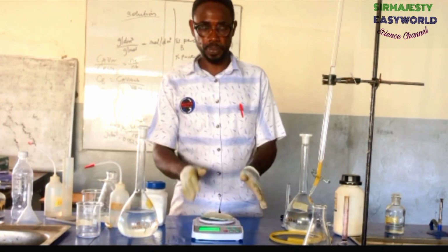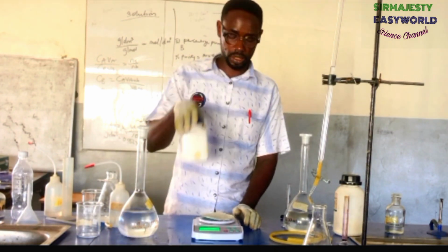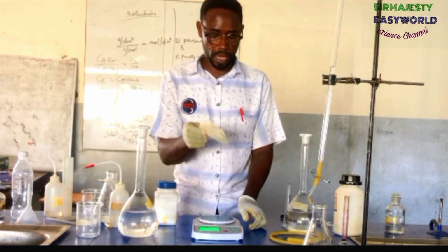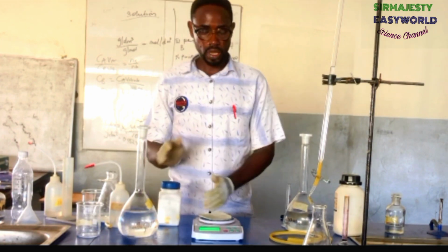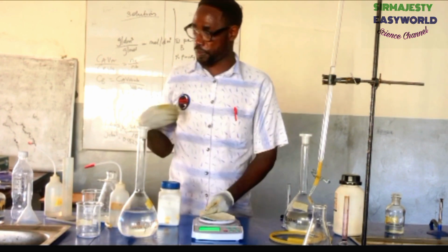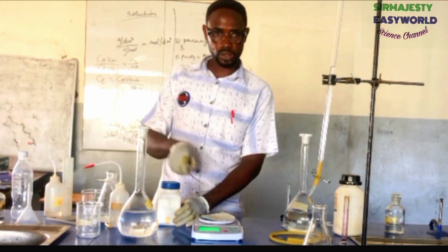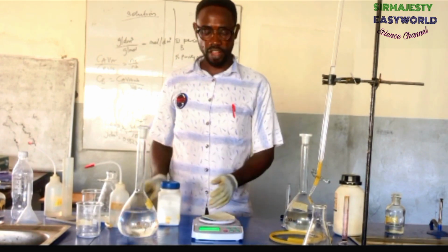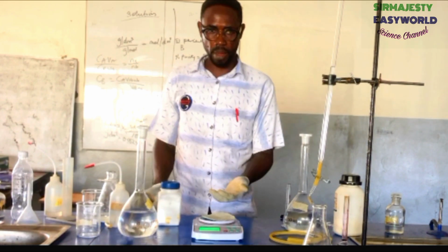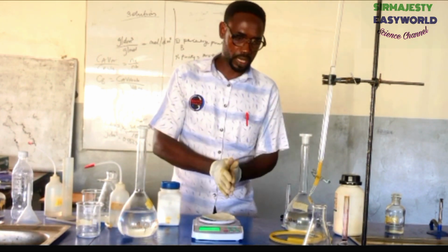But when you measure them separately, when we measured the sodium carbonate, we wanted everything to be 6.3, both the mass of the filter paper and the carbonate. And you see this is reading now 7 grams. You now use your spatula and eventually do what? Scoop and take it back, scoop the excess. It is pure. But when you have mixed it with nitrates, which one? How will you know I'm removing nitrates? So don't measure them together. Measure them separately and mix them together.